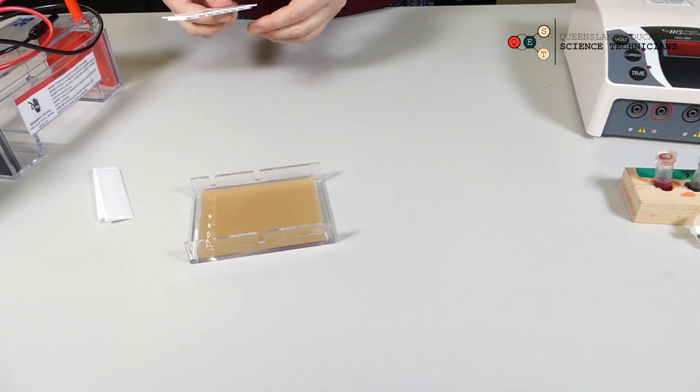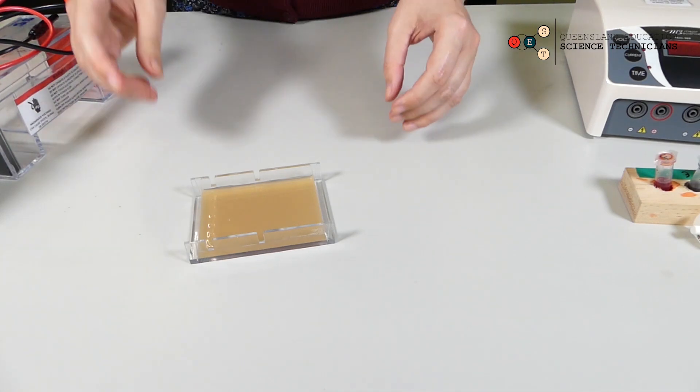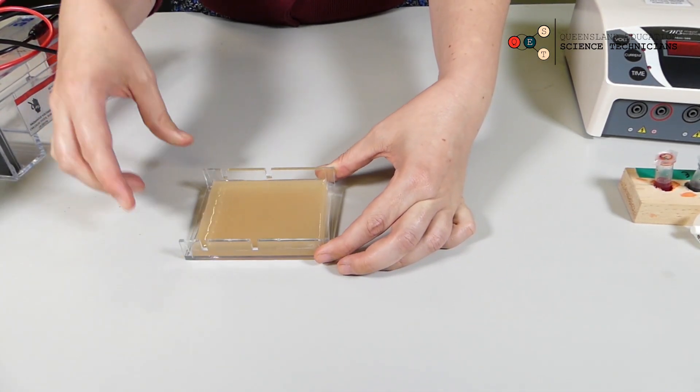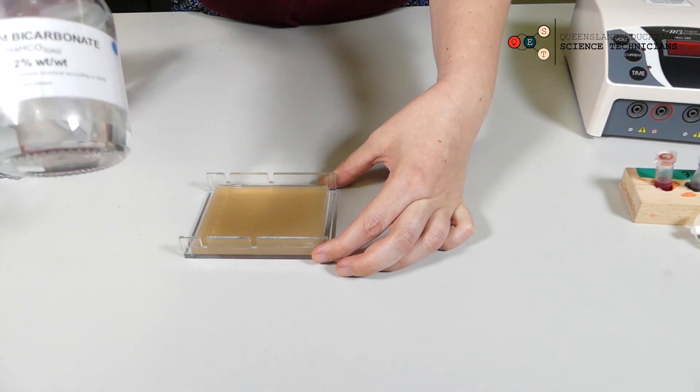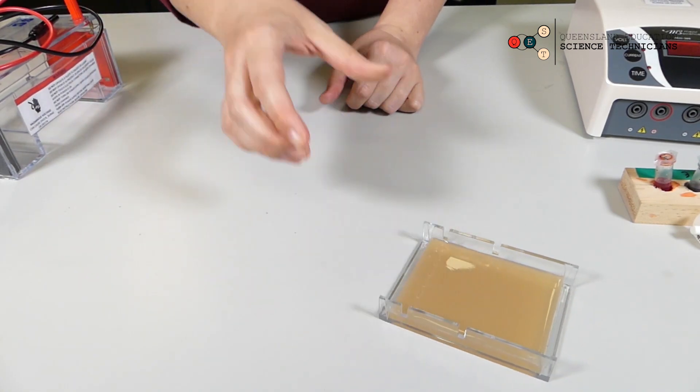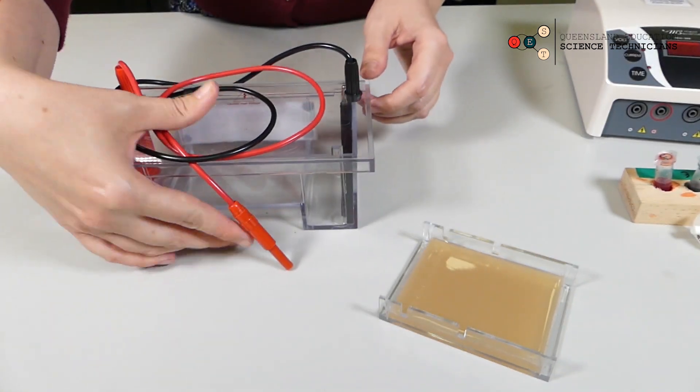So now we have an agar gel made with our sodium bicarbonate buffer. I'm going to load this gel into our electrophoresis chamber.